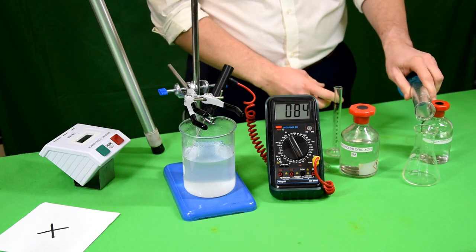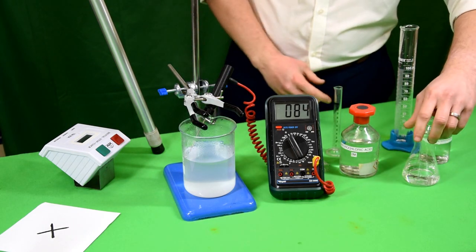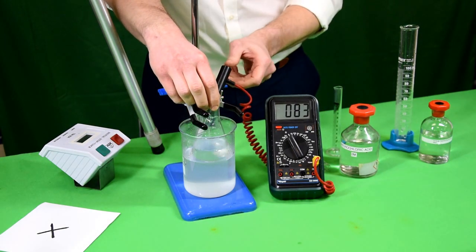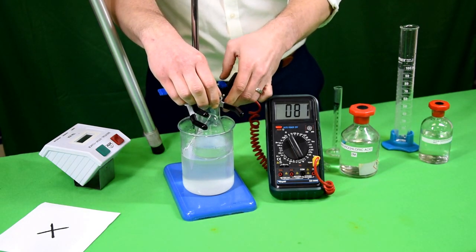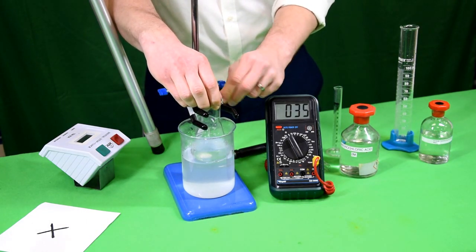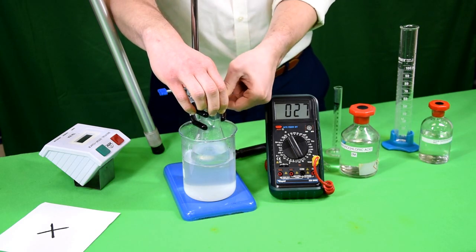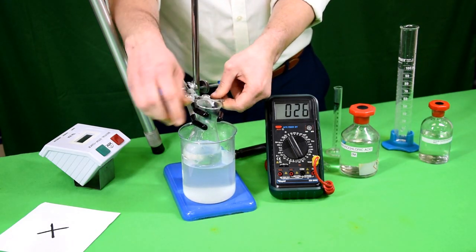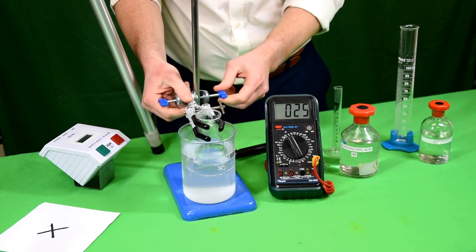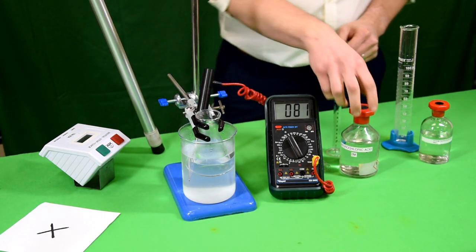Starting by placing 50cm³ of sodium thiosulphate into a conical flask, then placing the conical flask into a water bath and leaving it for the temperature to reach equilibrium. We're using a digital thermometer to keep track of the temperature of the water bath.